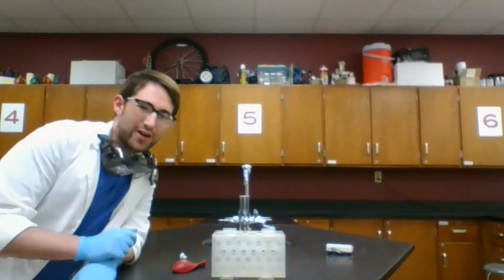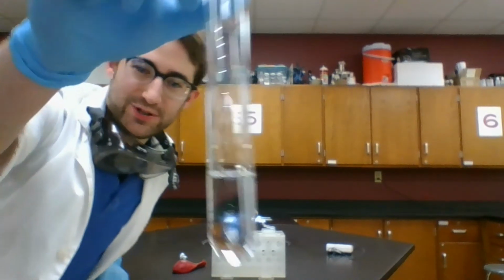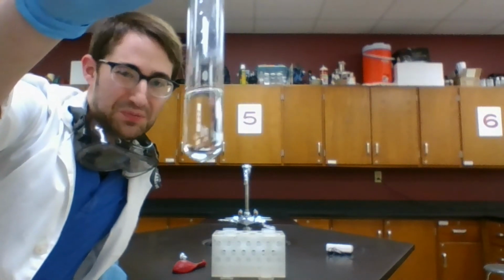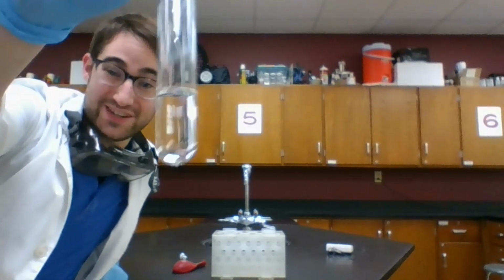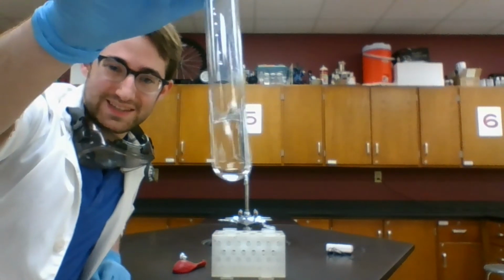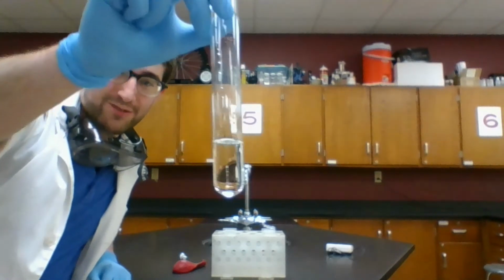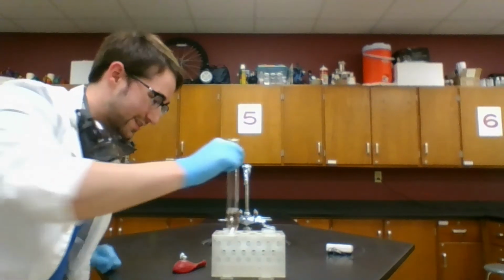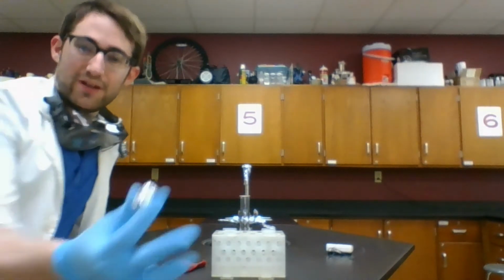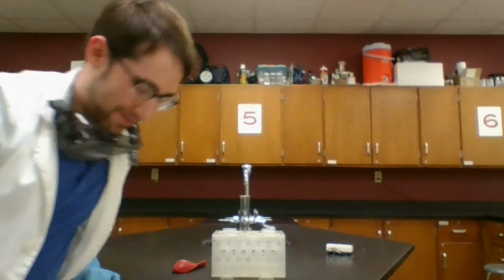I've got a test tube of hydrochloric acid here. At first glance, it looks pretty much just like water, which is a testament to why you should always assume something in lab is dangerous. You never know if it actually is or not, unless you know the substance and do some testing. So this is concentrated acid. It's pretty dangerous, so I'm wearing gloves, and I'm going to be putting my goggles on in a second. I'm going to drop in a piece of aluminum foil, just like this, and see what happens.